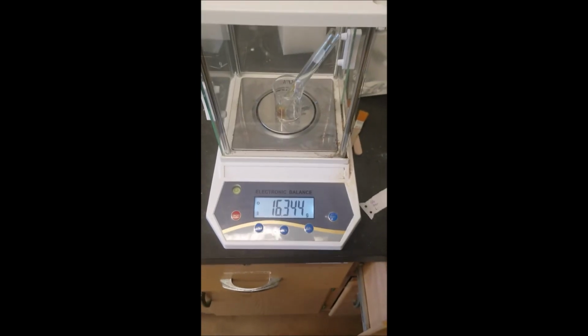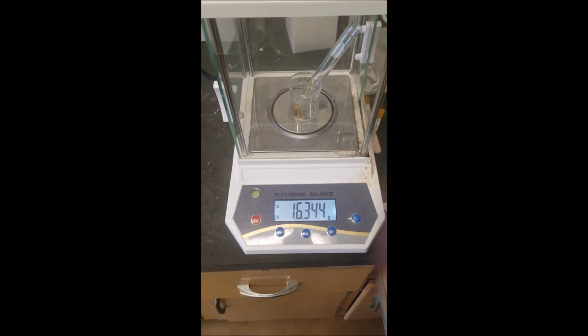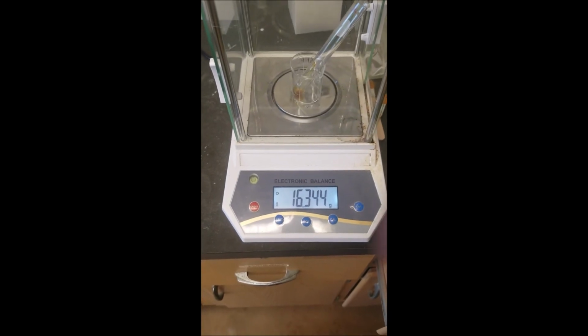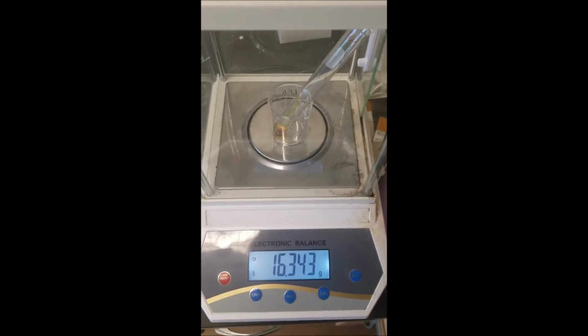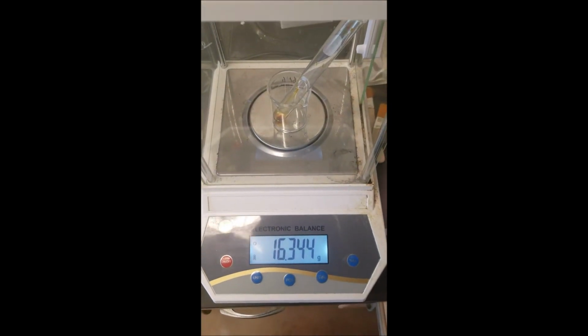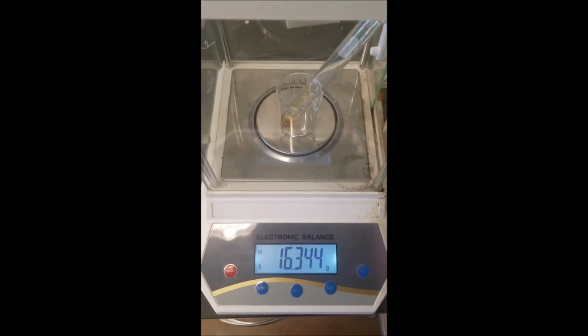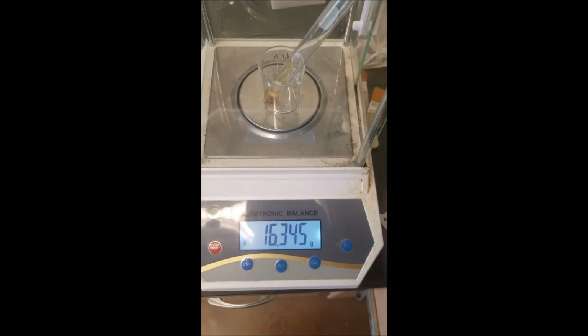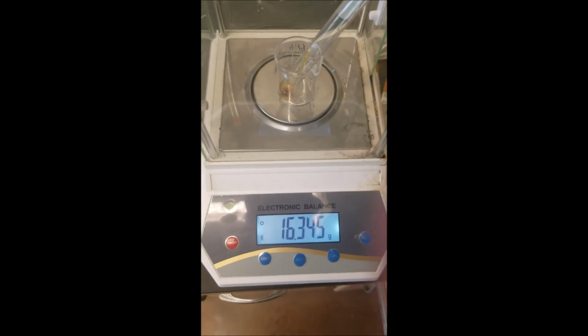Attempting to dry this, it just became a paste, kind of oily paste. I don't think I can get crystallization, so my sample weight is 16.344. May have lost a little bit trying to crystallize it, the spatula, but 16.345.